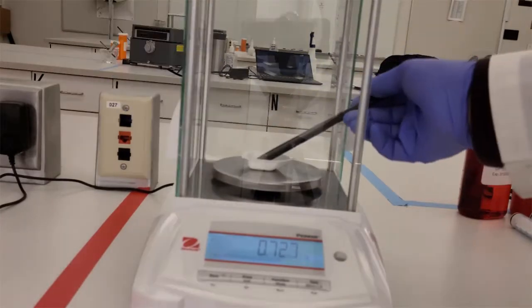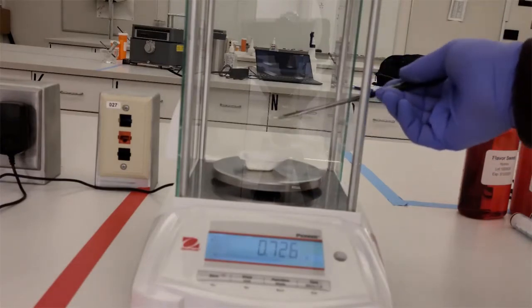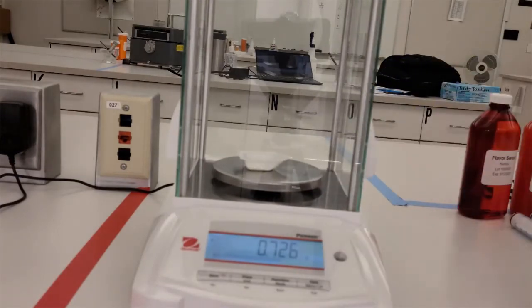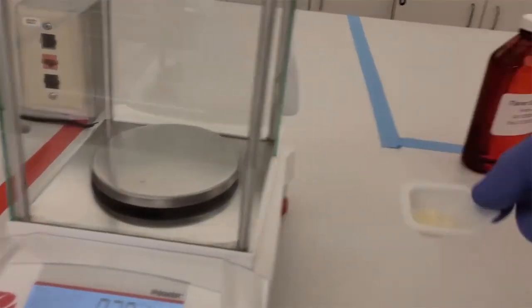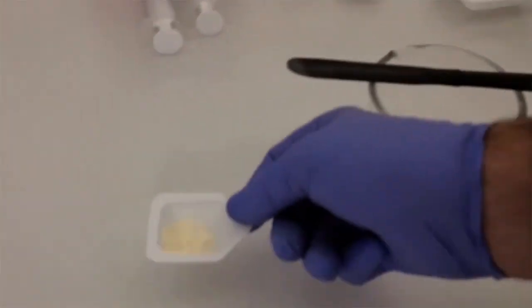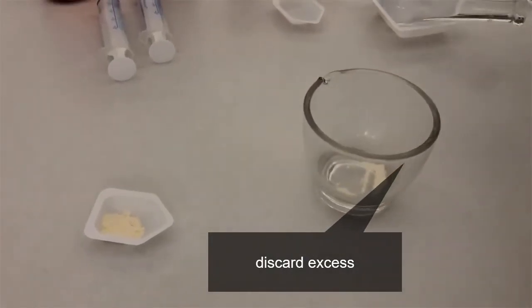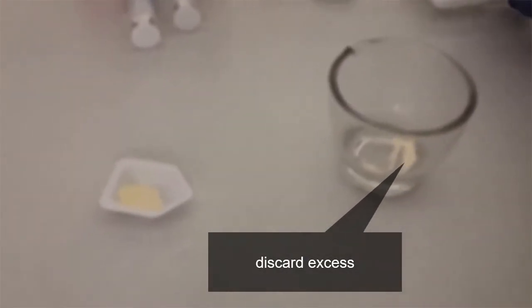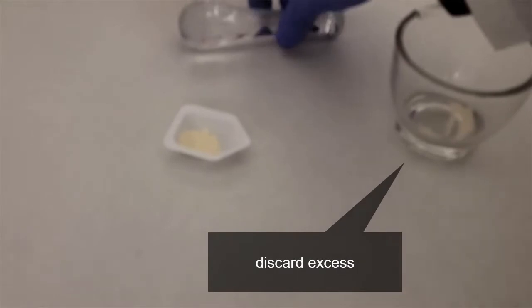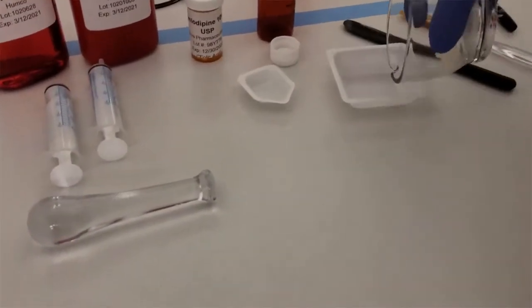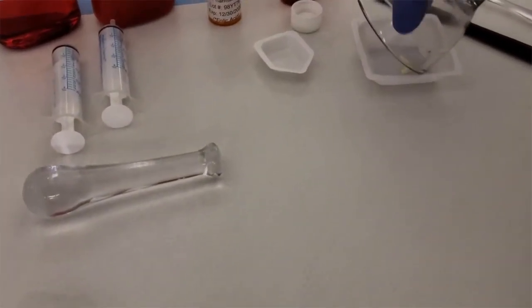And in this case, when I am done measuring that out, I'm going to have some excess in my mortar and pestle. So here's the finished amount that contains 35 milligrams. My mortar and pestle has the excess. I'm going to discard that. So that's essentially the remaining 5 milligrams of amlodipine that I want to discard. Your facilitator will tell you how to dispose of that appropriately at your facility.